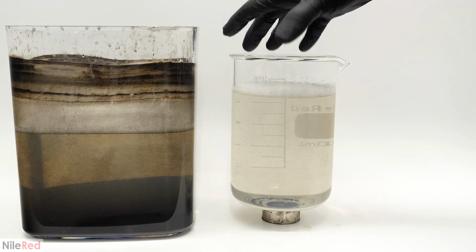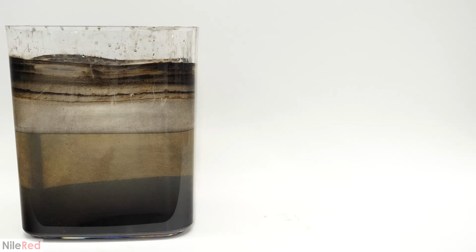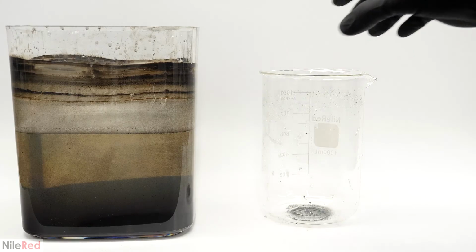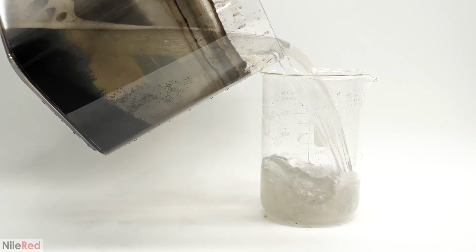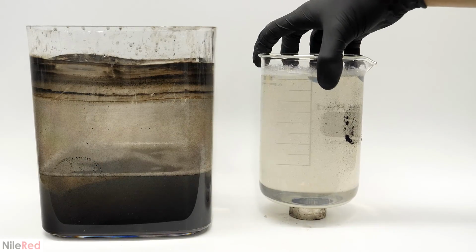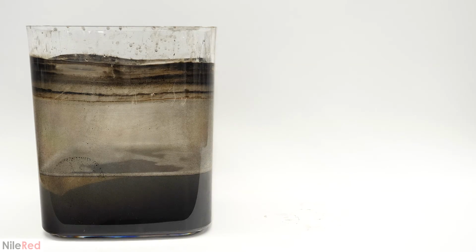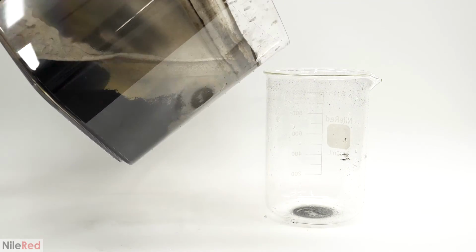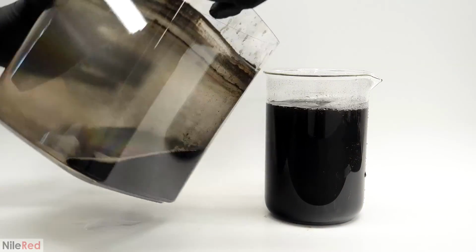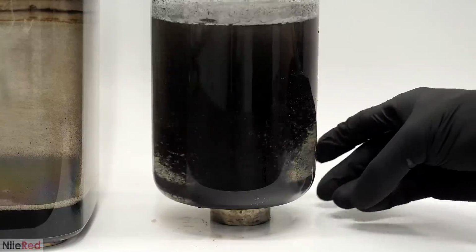There were some that were still floating around, but anything that didn't get almost immediately pulled out was only weakly magnetic, and I didn't want it anyway. This water was then dumped off with the help of the magnet, and I did the same thing again. On the third time though, I was actually able to include a lot of the magnetite that was sitting at the bottom. And because of this, the separation with the magnet was a lot more interesting.